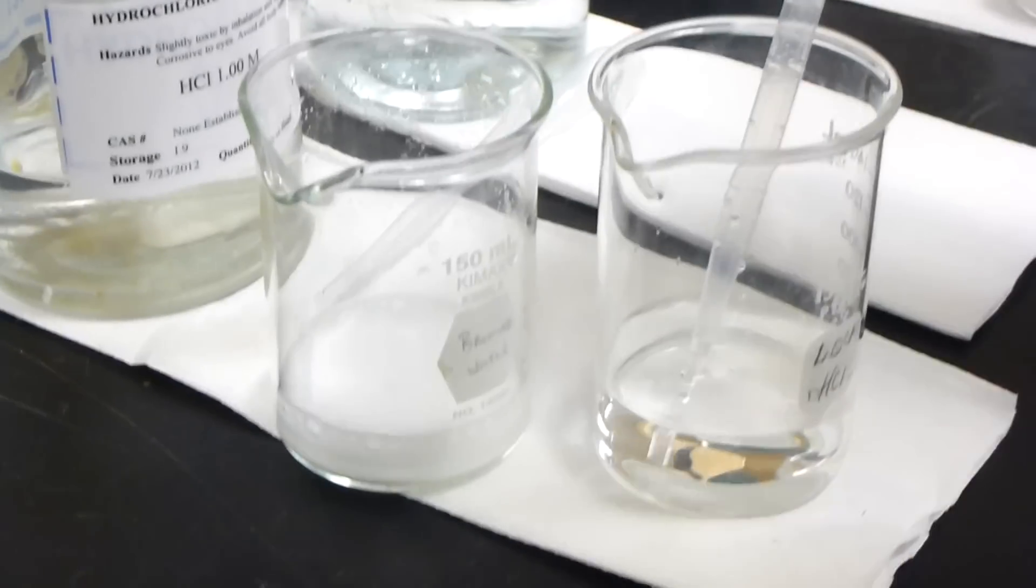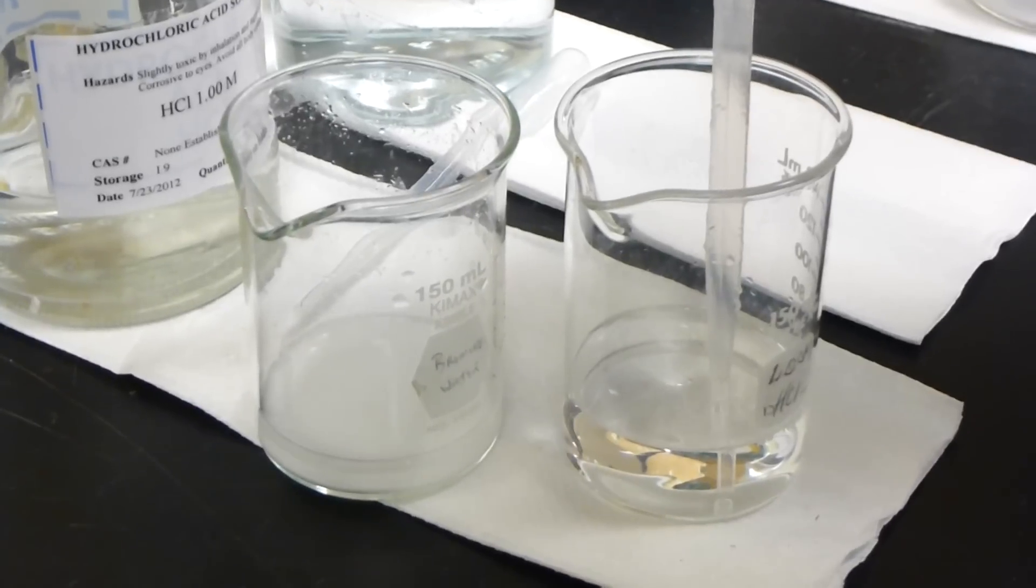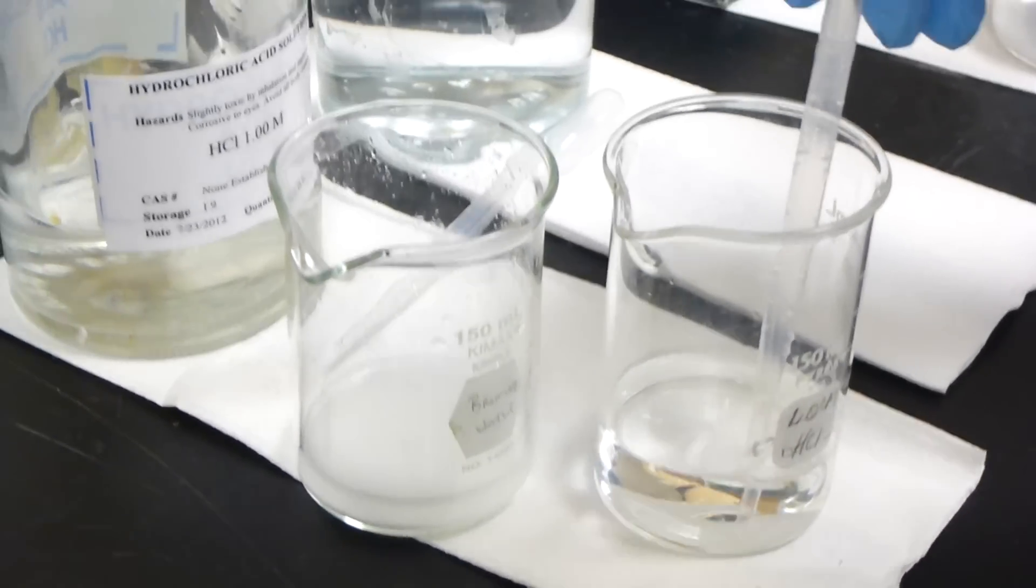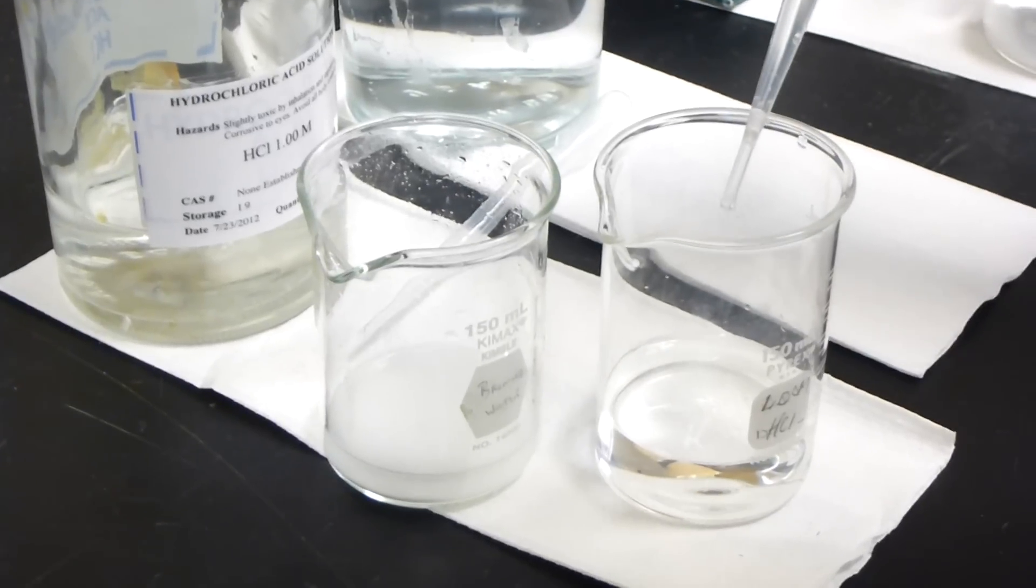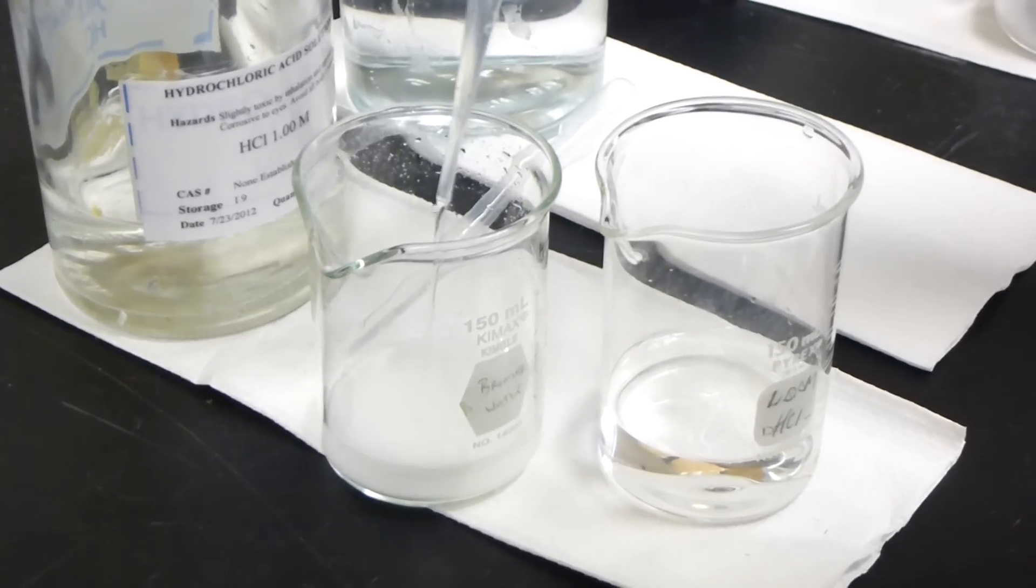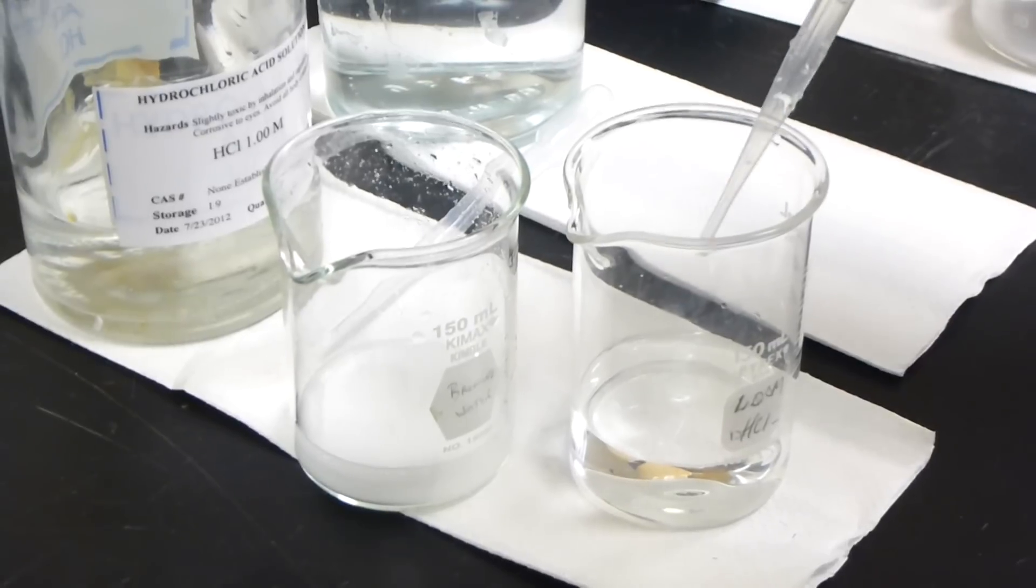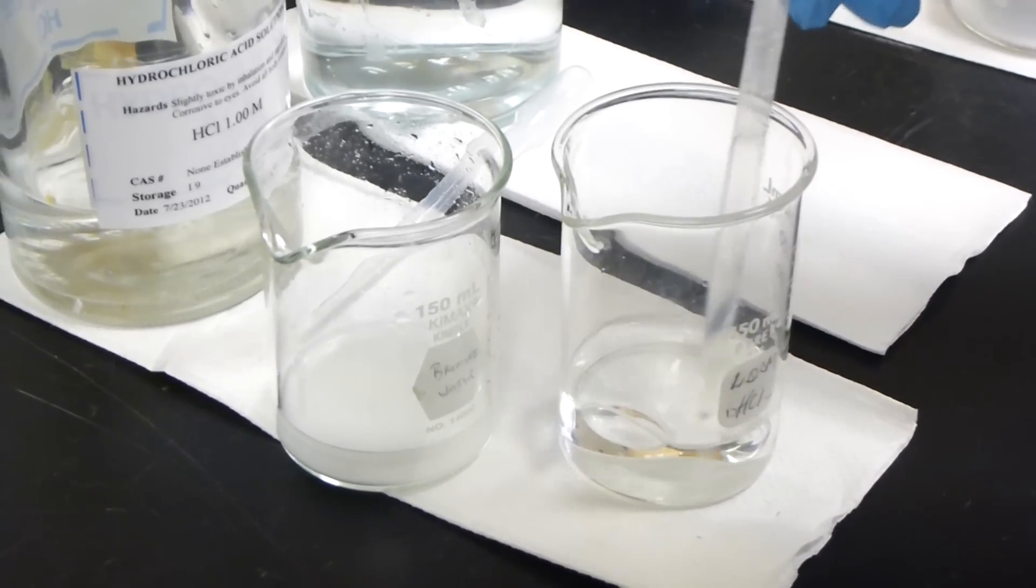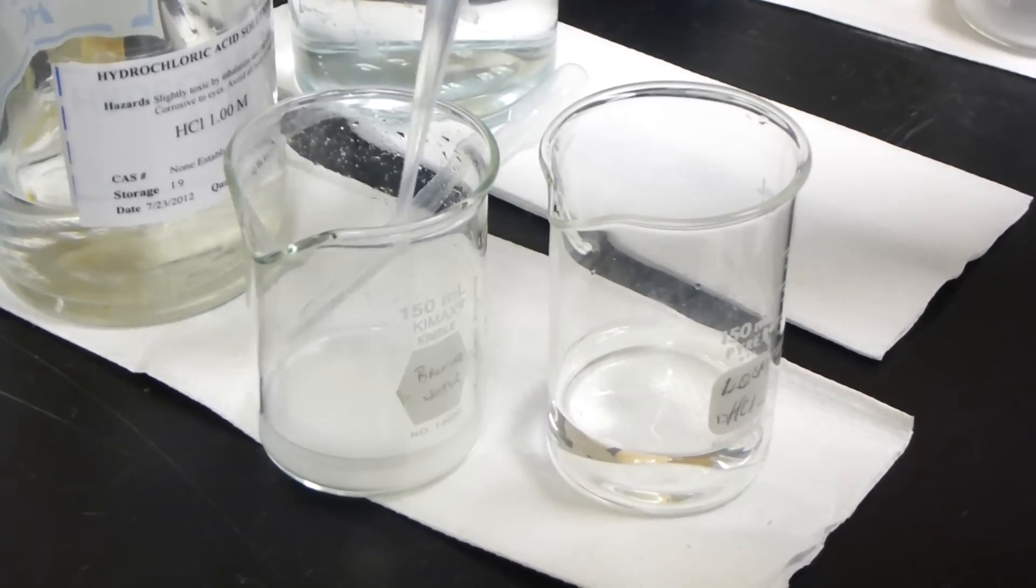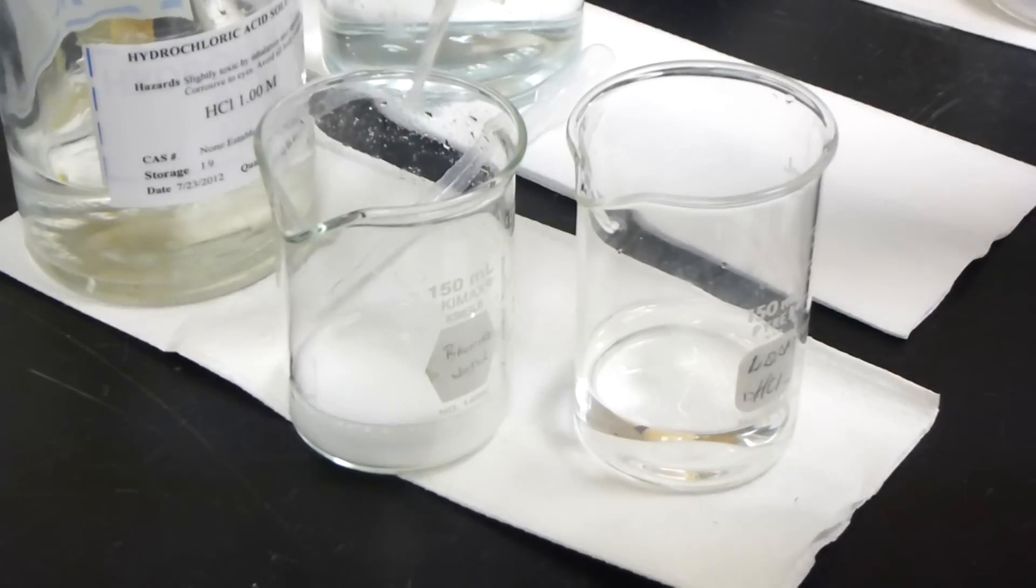I wanted you to see what it was doing. Jessica, see what it's doing. I'm gonna put some more in. It's being quiet now. Yeah, it's kind of like pouring pop. It's not done yet, like pouring pop and you don't know when it's gonna stop fizzing.